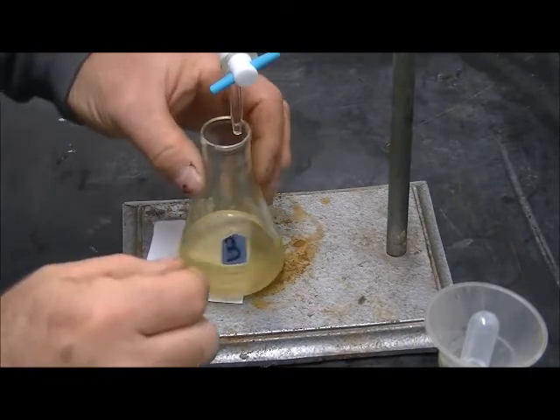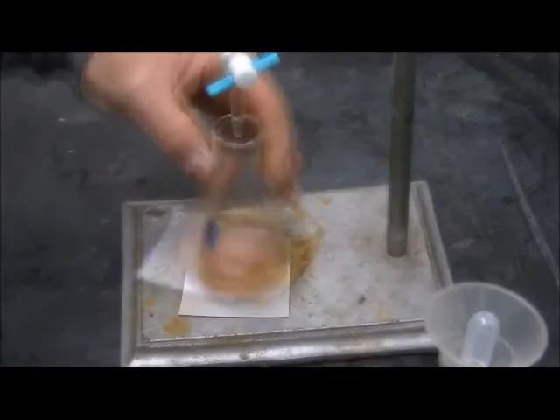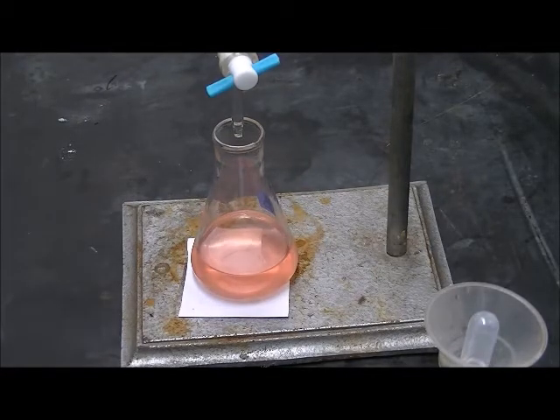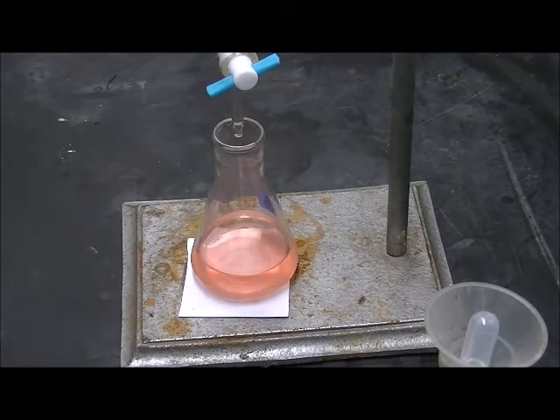This is unknown C, sample 3. The reading is 33.2 milliliters.